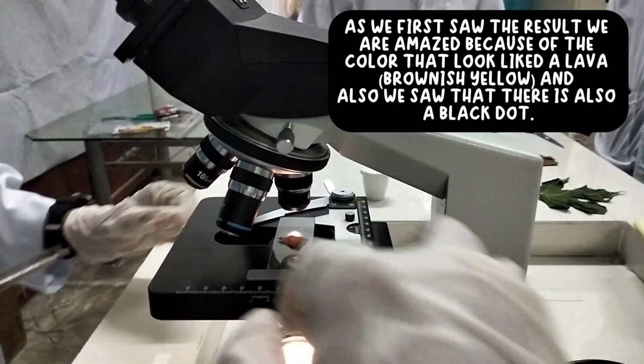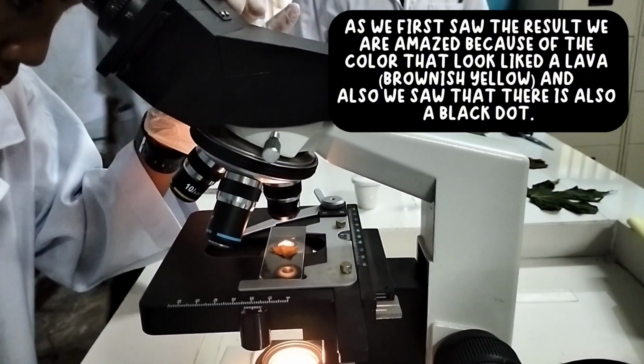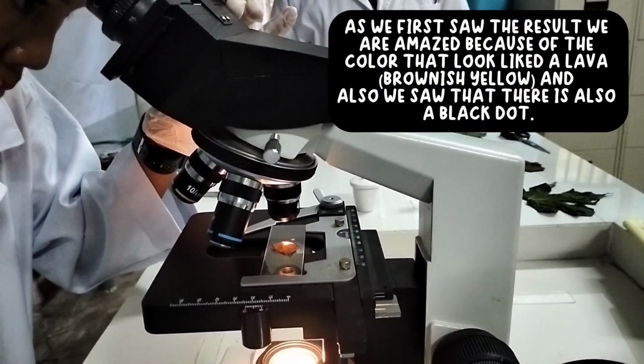As we first saw the result, we are amazed because of the color that looked like a lava, brownish yellow, and also we saw that there is also a black dot.